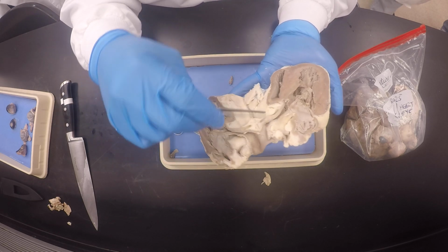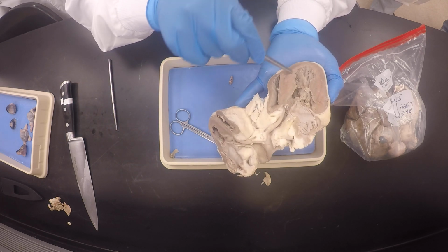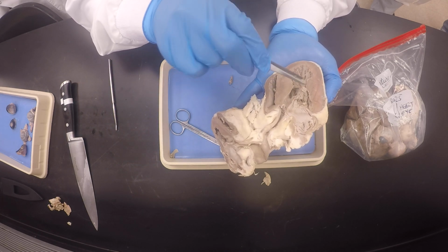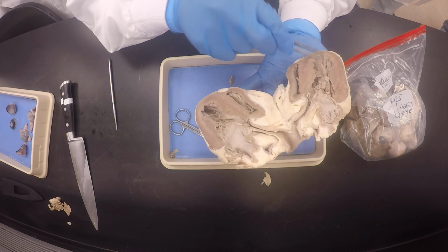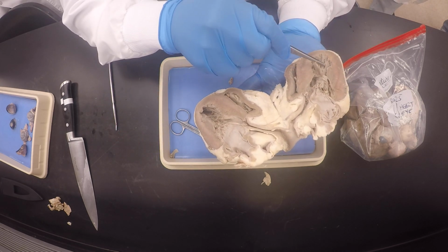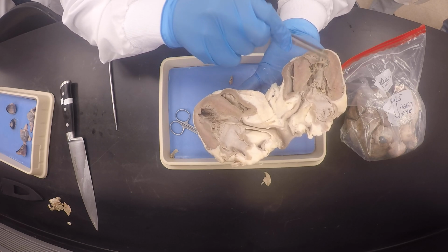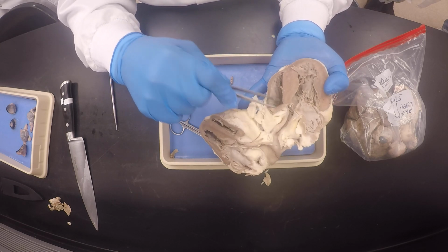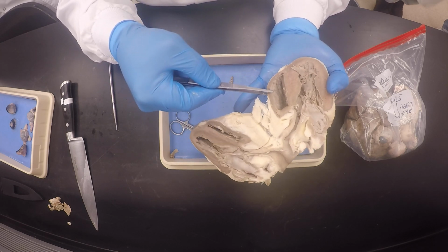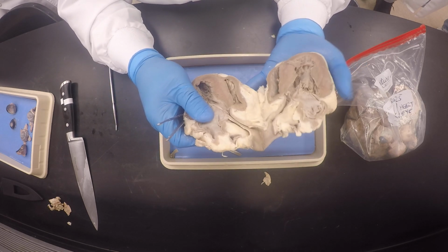And I'll show you. So this one, what valve would this be? You can see it's on this side, right? It's an atrioventricular valve, right? Because this is, which ventricle is this? This is the left. This is the right, which is small. You see how even the muscle is thin, except I cut my moderator band here.